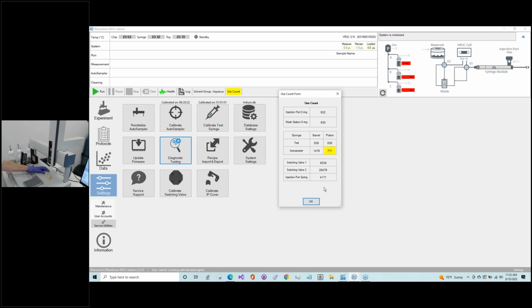And while we're talking about the wash port, as an aside, if you're doing the aqueous cleaning, which uses buffer as the primary solvent, buffers have salts of various sorts, and over time they can build up a little bit around the wash port area. This generally doesn't cause a big problem in terms of functioning of the unit, but while you're changing out the O-ring, you'll want to periodically wipe that down, just salt buildup that you can probably see here.